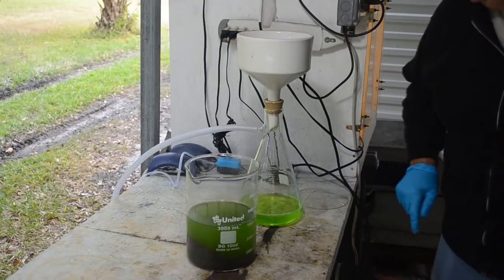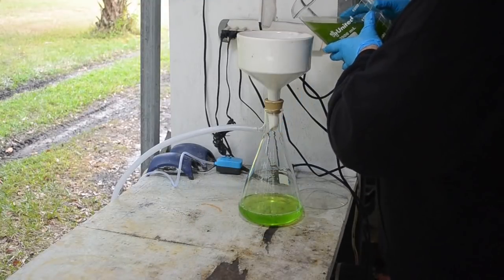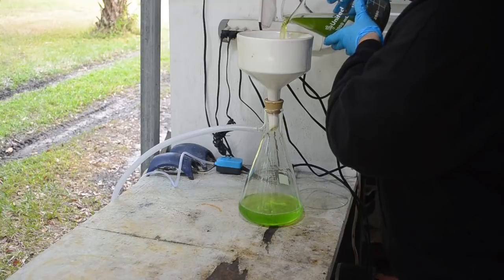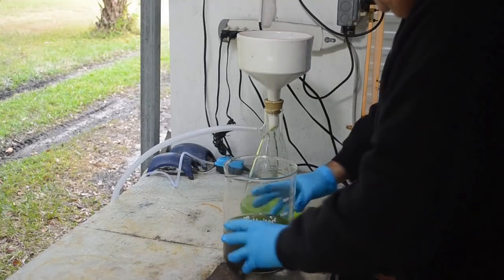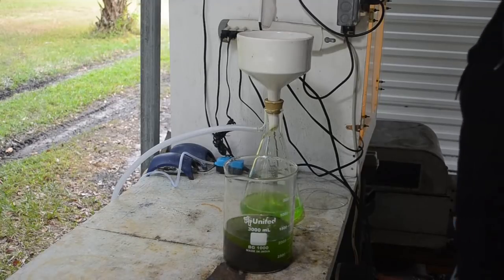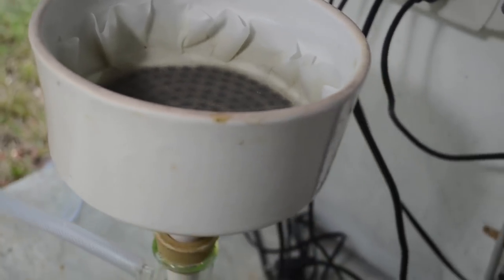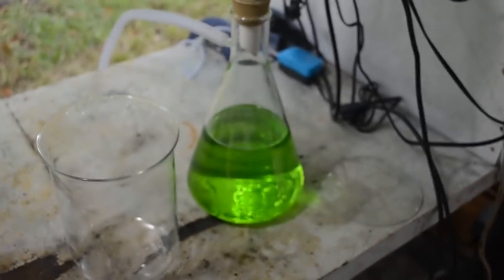Yeah, just a little bit cloudy. Alright, so it'll need a couple filtrations, but the second one may be good enough because by then the filter will be loaded up with whatever this stuff is. And it won't make it through the pores in the filter a second time with any luck. So this is going to take a little while. So there's what the filter captured on this liquid's first trip through the filter.